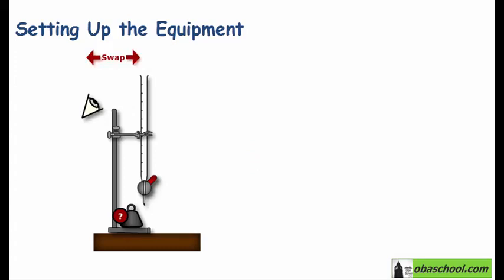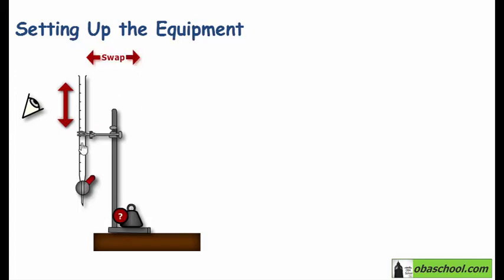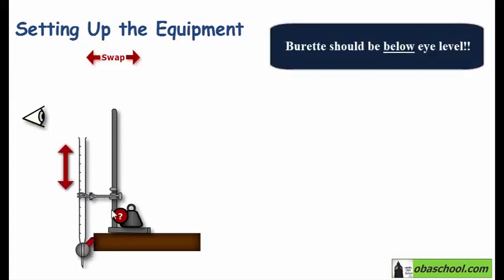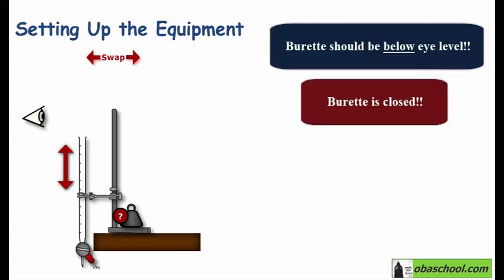So first of all, when you want to fill the burette, place it on this side, and the burette should be below your eye level. So let's move it downwards until it's below the eye level. Another point is to make sure that the burette is closed. Of course, we don't want to pour our solution into the burette without closing it, because this means that we are wasting our solution. So we will close the tap over here. So now the burette is closed. No solution can pass from the tip.